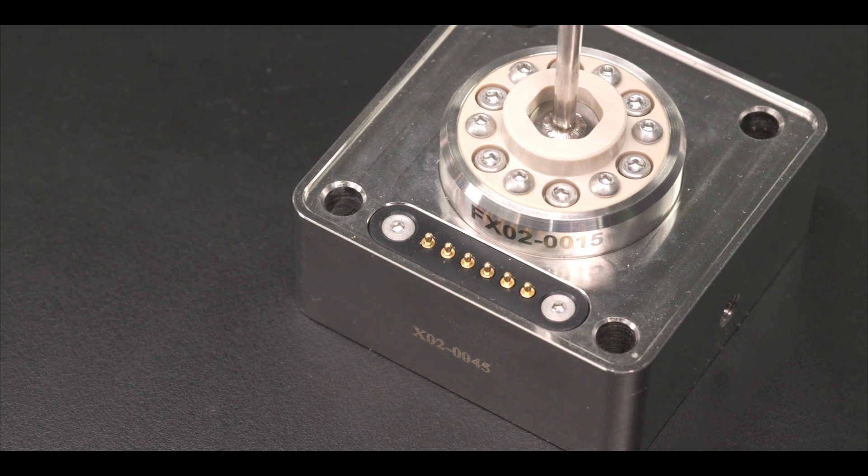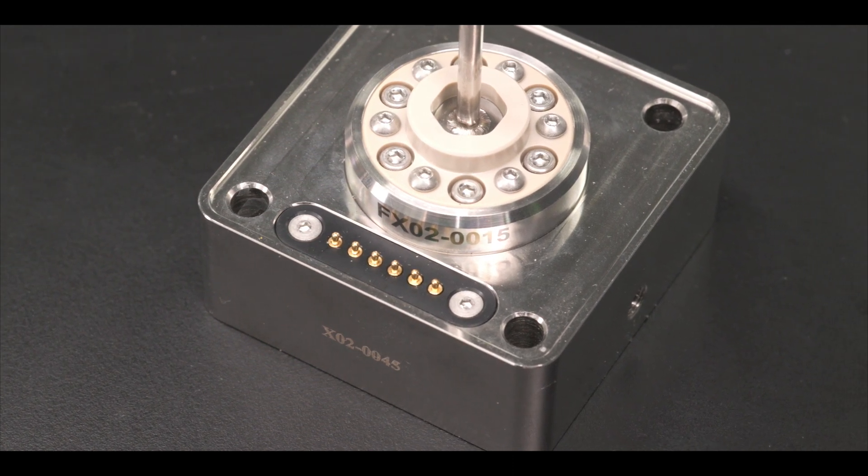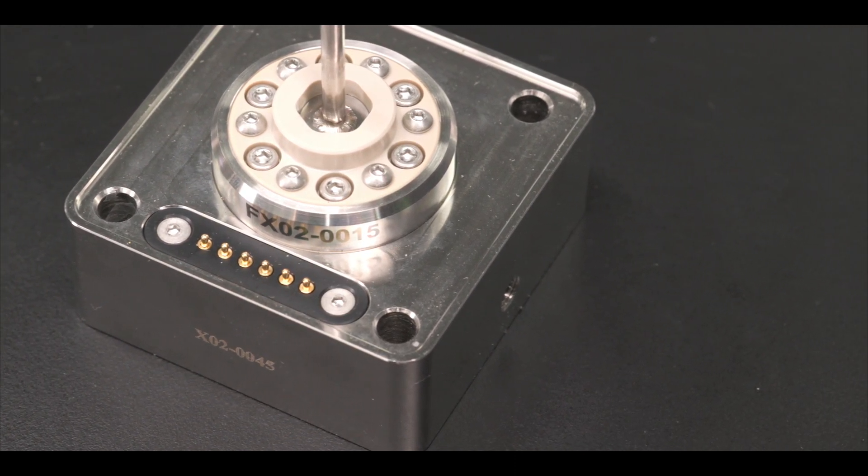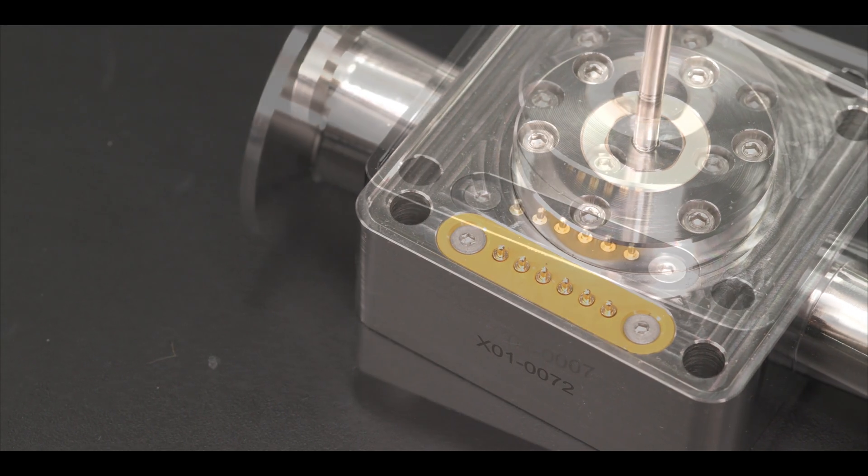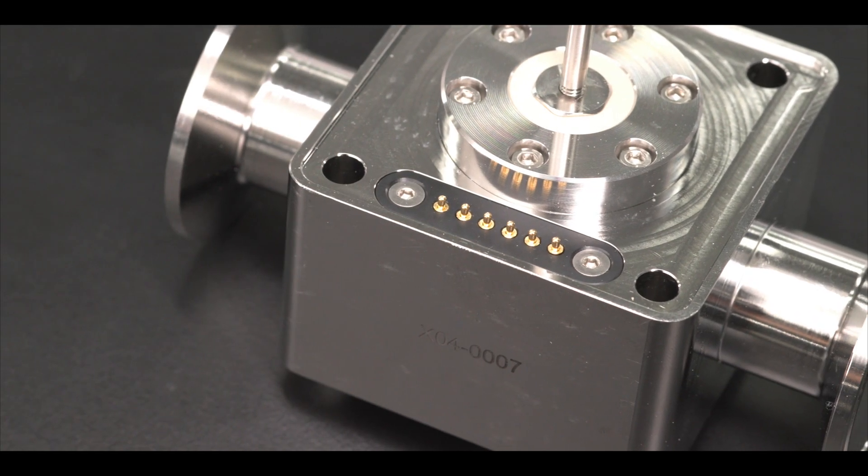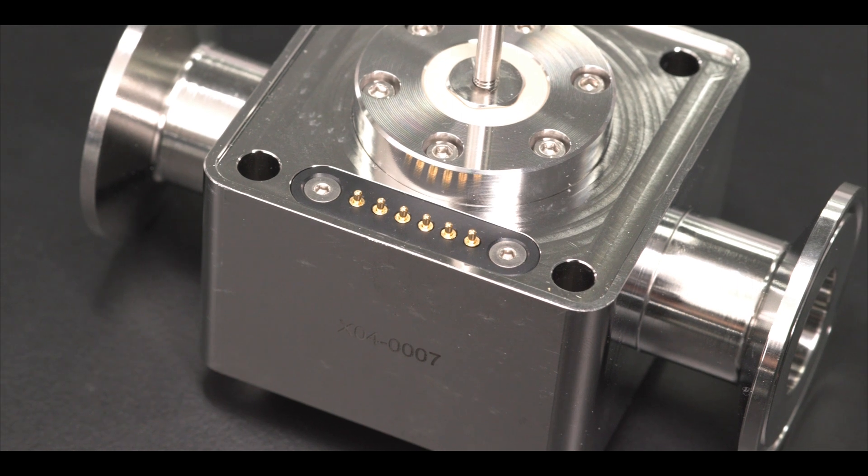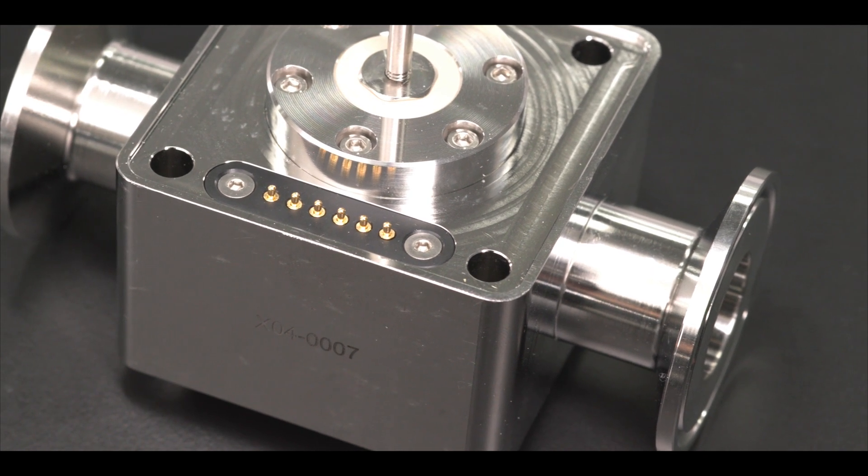The 3 millimeter stainless steel flow cell can be connected with your choice of compression fittings, luer, or barbed connectors included with the flow cell. The 10 millimeter and 22 millimeter flow cells respectively require half inch and one inch tri-clamp connectors.